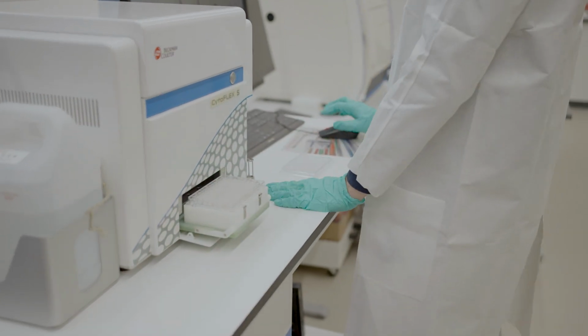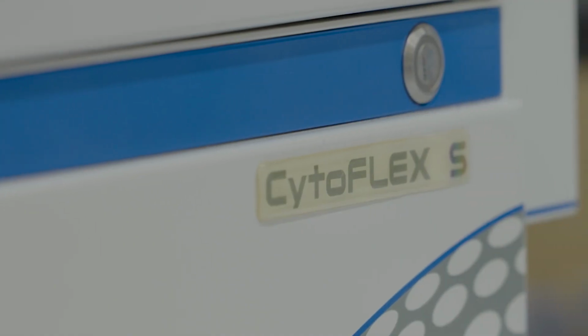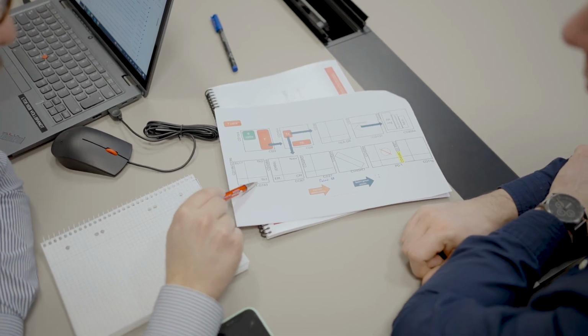My research centers around T-cell and B-cell biology, so having the capability to do high-dimensional flow cytometry is very important. Spectral cytometry is particularly advantageous for resolving fluorochromes with significant emission overlap and for reducing the effect of spillover spreading, improving data accuracy in multiplex experiments. However, simple experiments can still benefit from the simple workflow typical of the conventional mode.